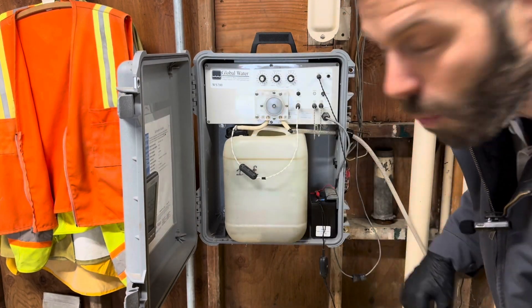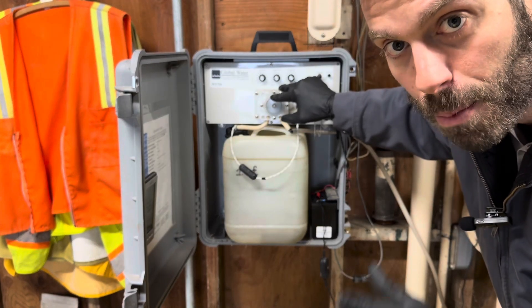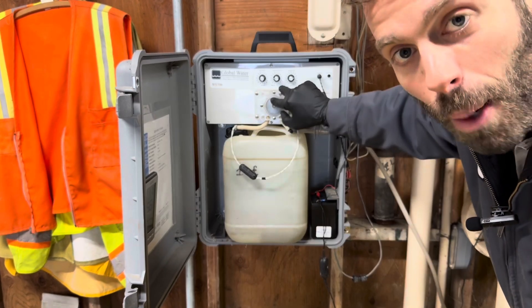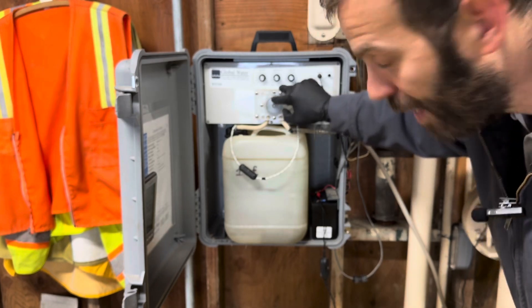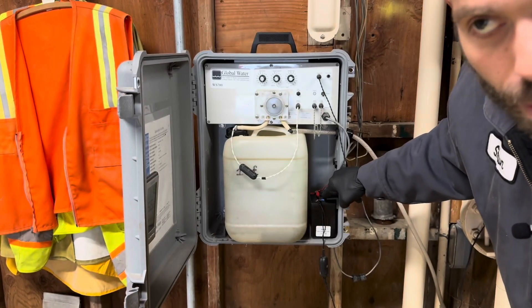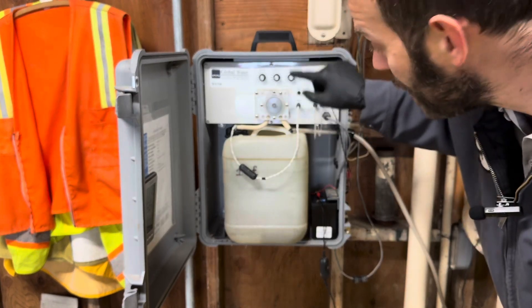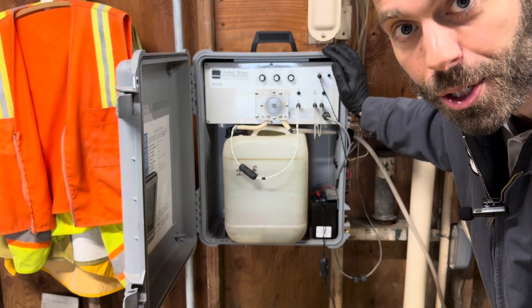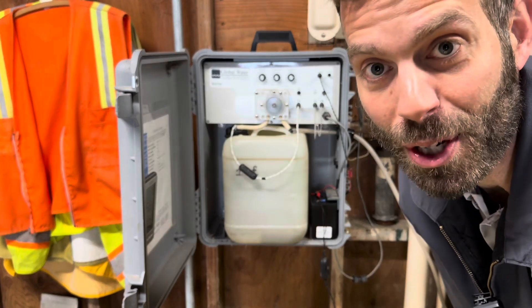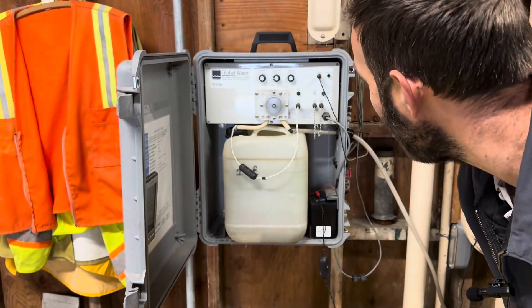I want to talk about changing these tubes — a quick safety note. Talk to your safety officer about all things safety. This is what's called a pinch point. Pinch points are where people lose fingers and limbs. Always disconnect your power source before working on the tubing. This is 12 volt, so I disconnect the battery; if yours is 120 volt, unplug it. These rollers go really fast — faster than you can react. Not worth the risk.